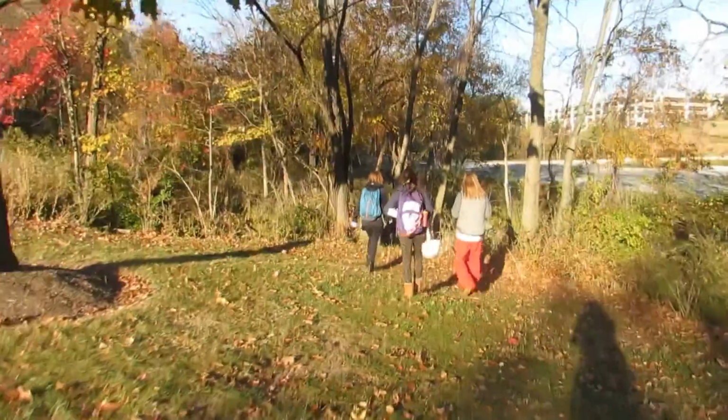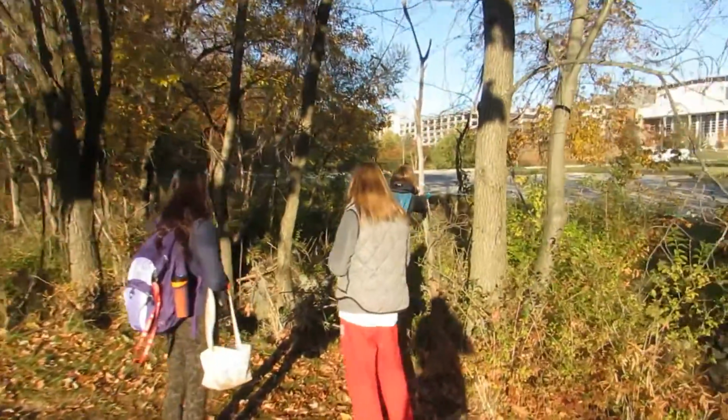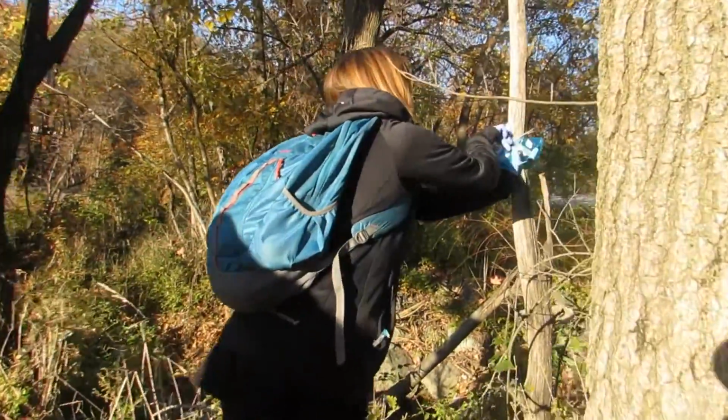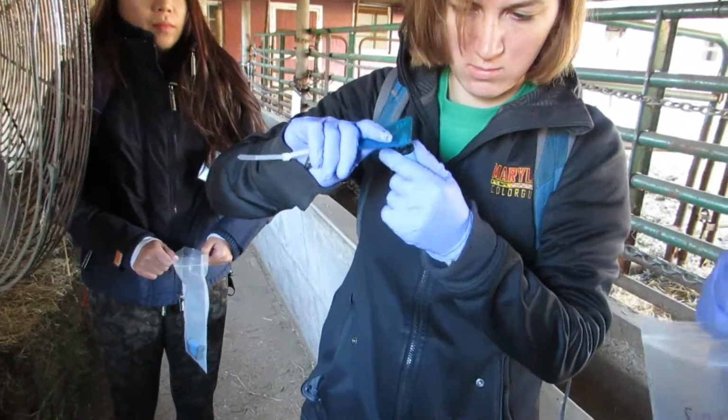After 72 hours, we returned to pick up the samples. Wearing gloves throughout, we cut down the samples and prepared to empty the diffusive body. We had the corresponding empty tube open in one hand and the diffuser body with the triangular plate on top in the other.